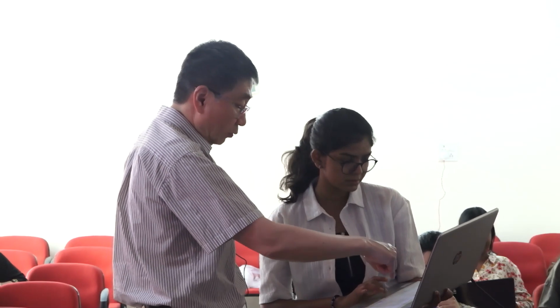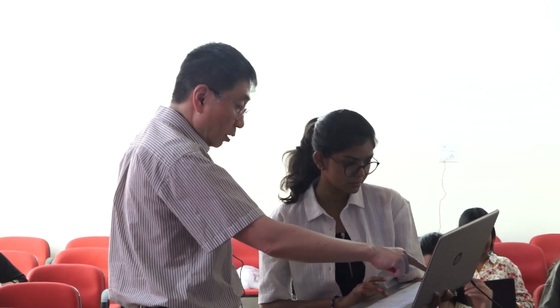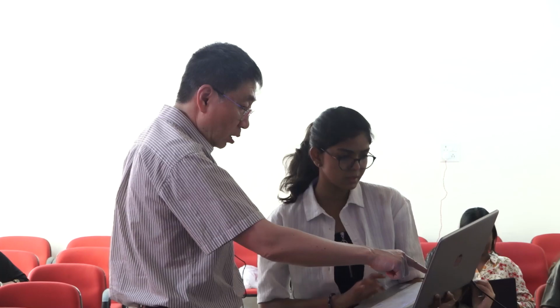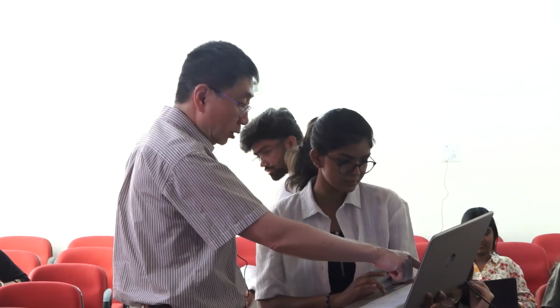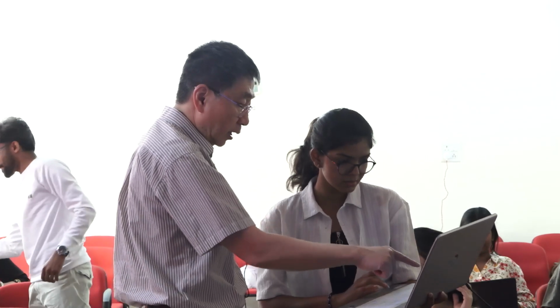And then you can do. What has just happened here? Let me see. Oh, it built another residue for you. So you can delete this residue, I guess. This? Yeah, you can delete that one. So delete.